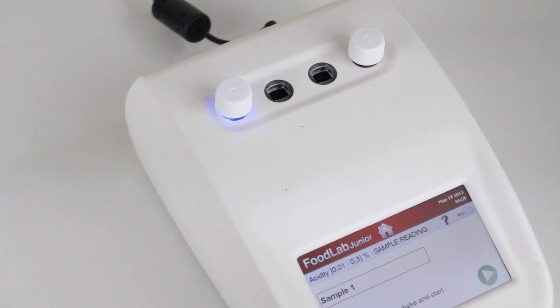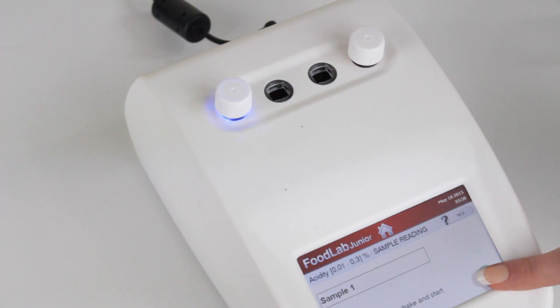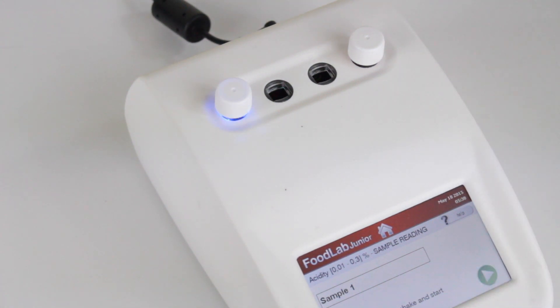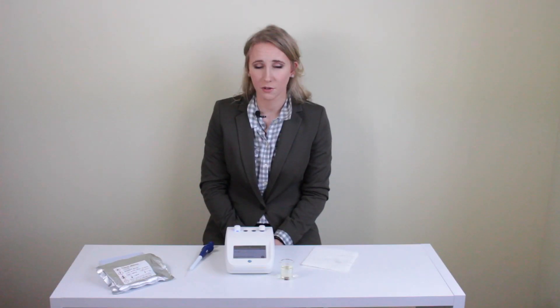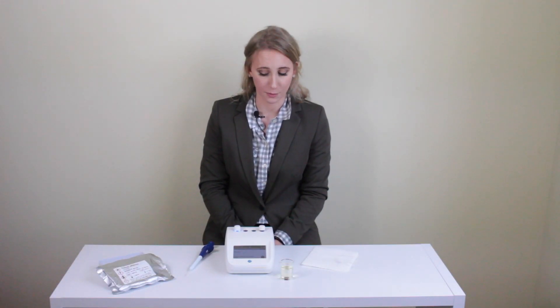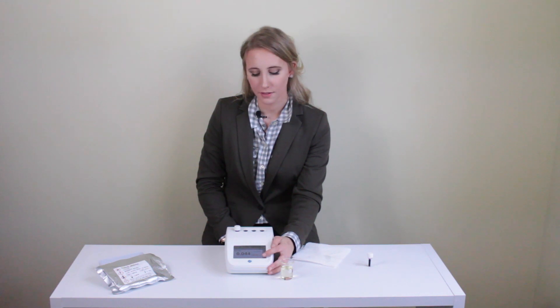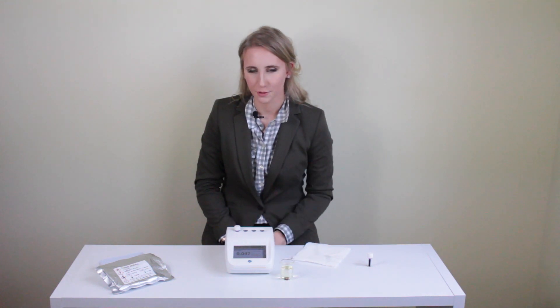From here, press the green arrow and this will be the sample reading. If you only did one sample, you're done and the result will be on the screen. If you had more than one sample, simply scroll down and you will see the next result. I hope this was helpful and happy testing!